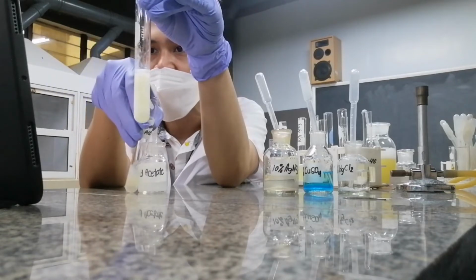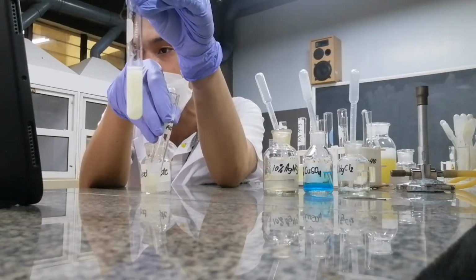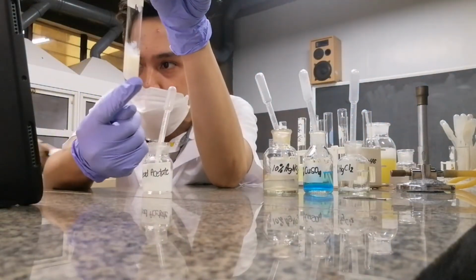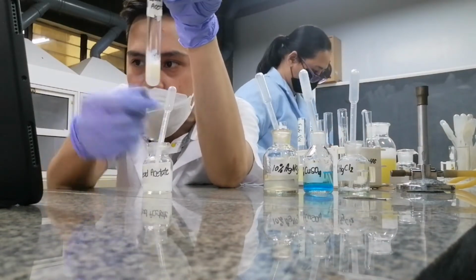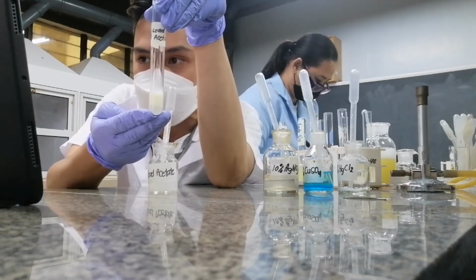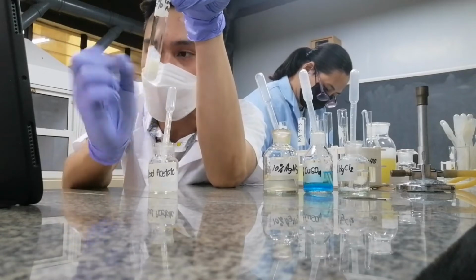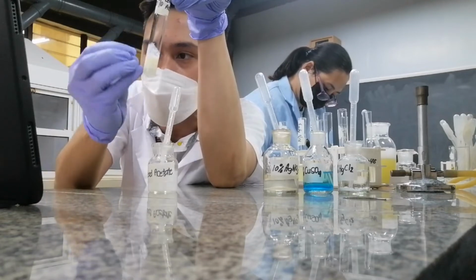As you could see, these clump together to form a very big solid. But in the case of your lead, try to look at it. It did not clump. Some of the solids separated, which means to say that there is the formation of a precipitate. Because if it's coagulum, the entire solution will be converted into a solid, white solid chunk.